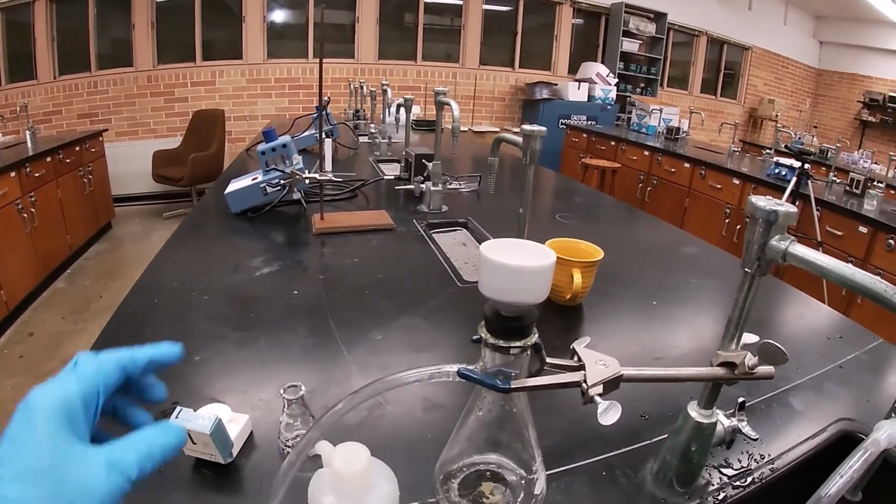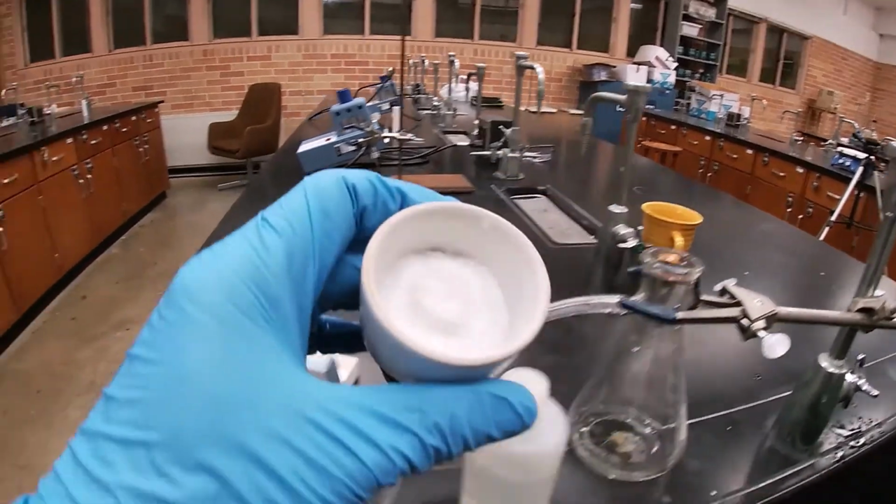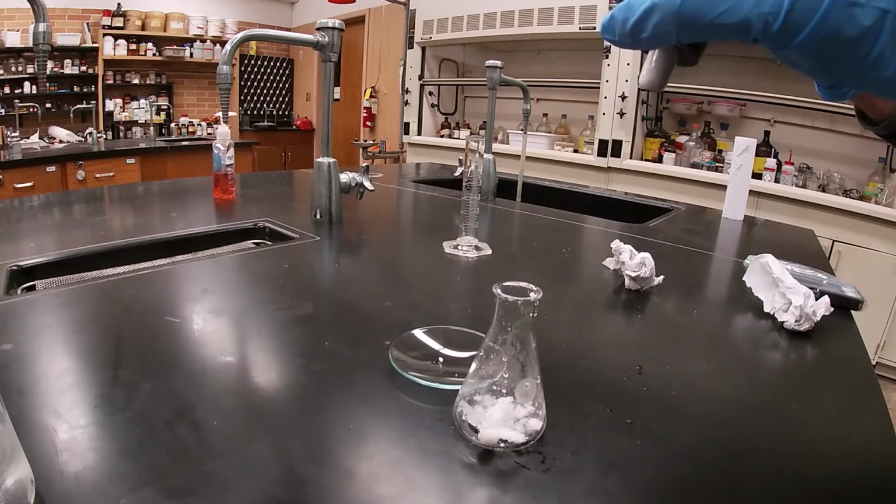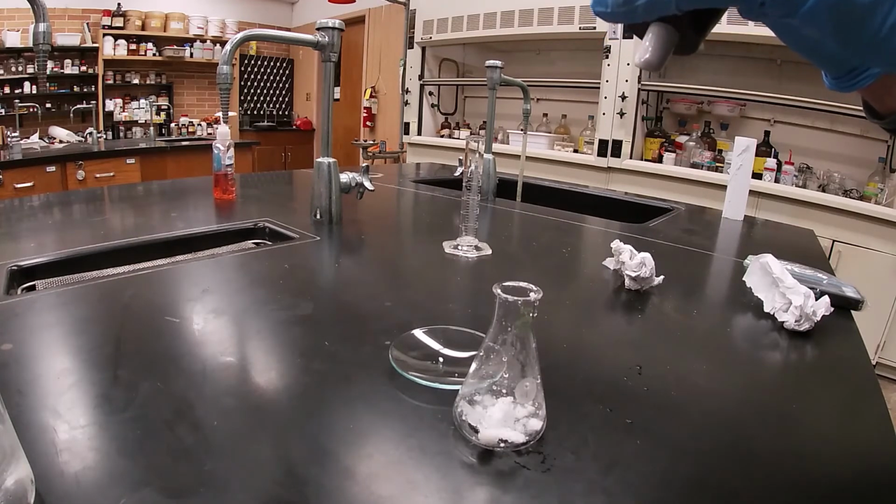I'm going to transfer my product back to the Erlenmeyer and we're going to do a recrystallization.